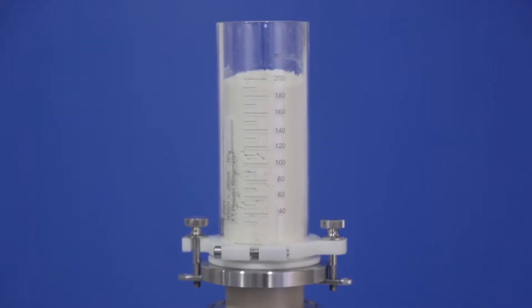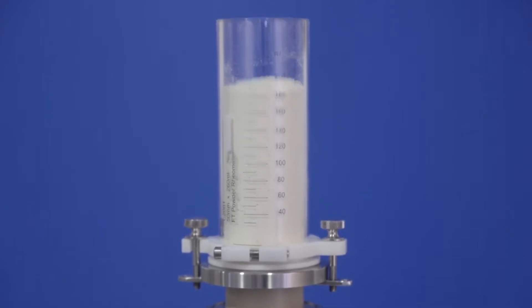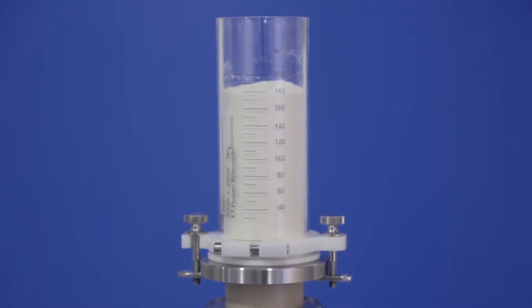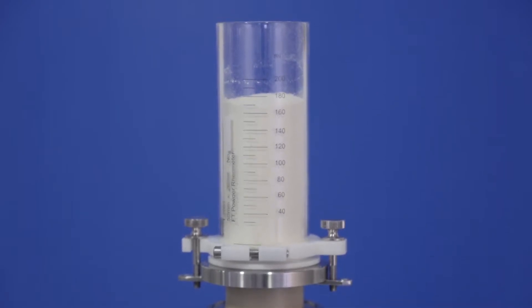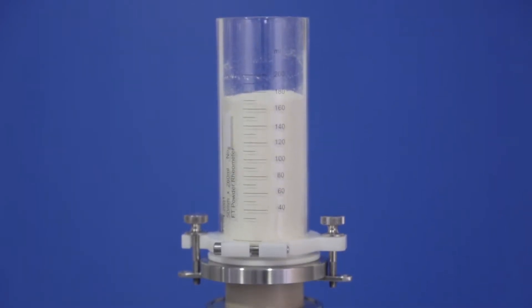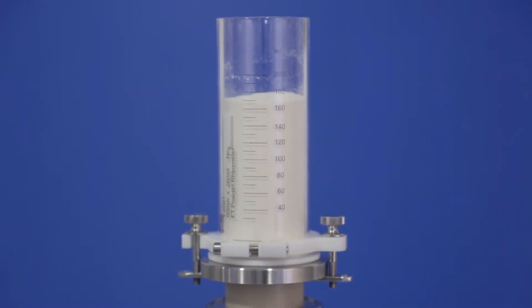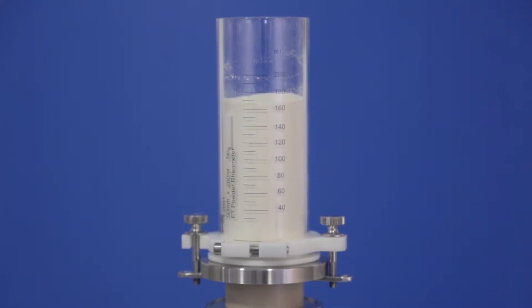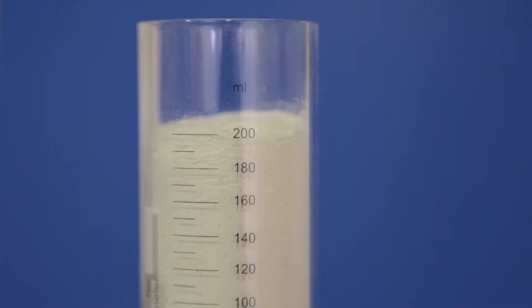Here we can see the sample put on a tapping device to subject it to some compaction, and just a few taps transforms the way the powder behaves. Its density change might be in the order of 10, 20, or 30 percent, but in terms of its flow property changes, it now might be five to ten times less likely to flow.